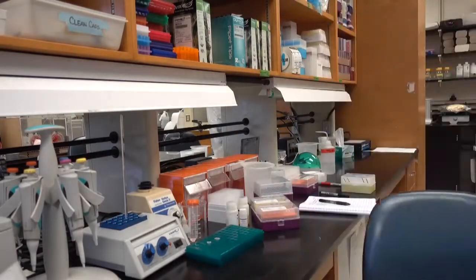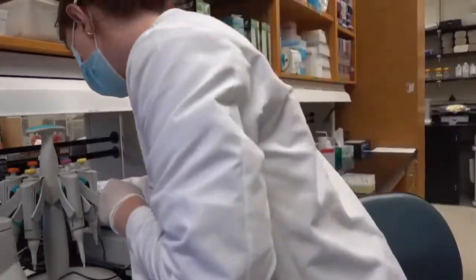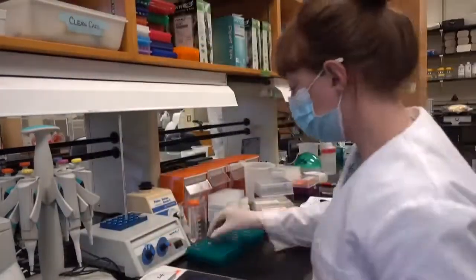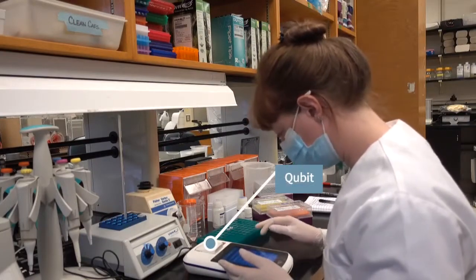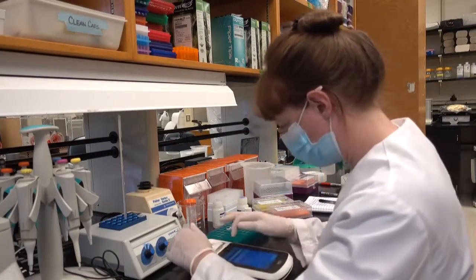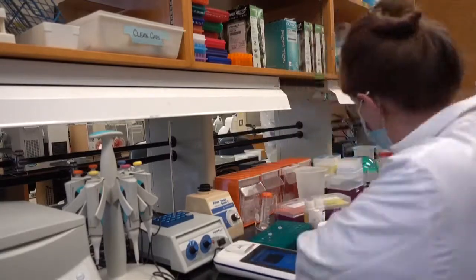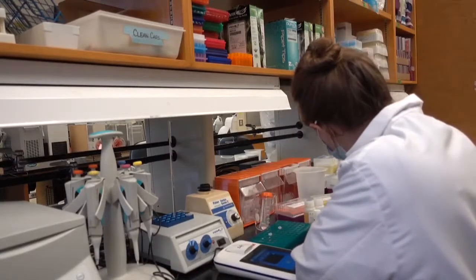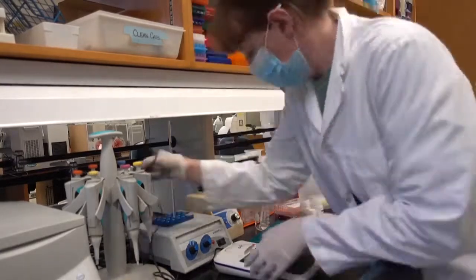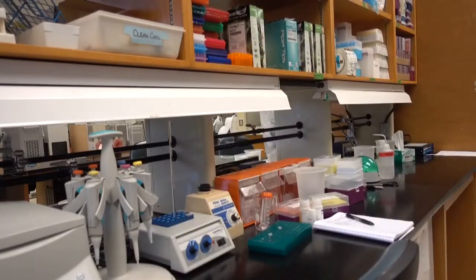And then once I'm done with all the different steps in the DNA extraction protocol, I use a machine called a qubit, which allows us to determine the concentration of DNA that we end up with in our tube. And I did a little happy thumbs up because it worked, and we ended up with good amounts of DNA this time around.